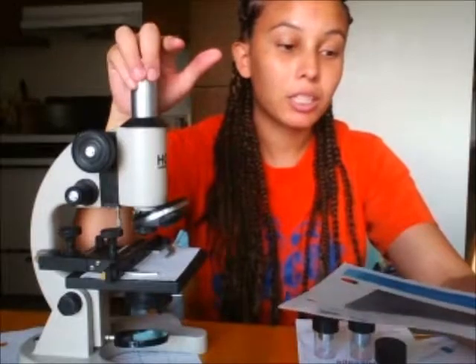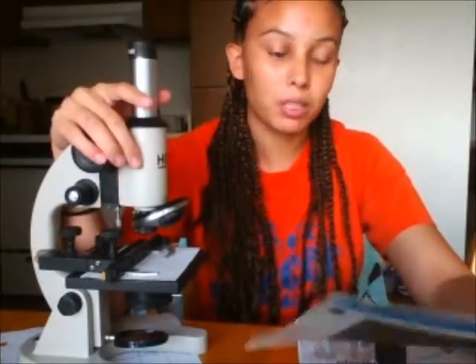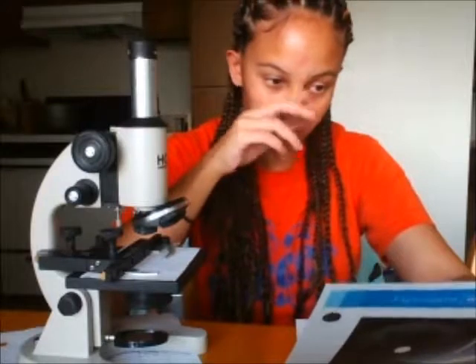I am beginning experiment microscopy for microbiology use and function. I am starting with exercise 1, of course, and it is called Getting to Know Your Compound. My compound is my microscope here. It says gather microscope and assemble. Mine actually already came assembled through the box when ordered. The only thing I did was put my ocular lens into the slot there.